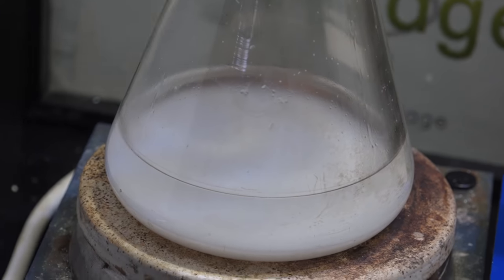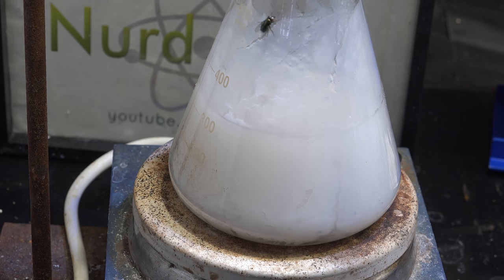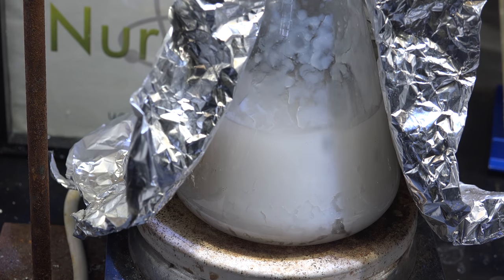The magnesium methoxide and the sodium hydroxide solution formed a sol-gel that was really hard to dry out. Oh well, back to more mainstream ideas.